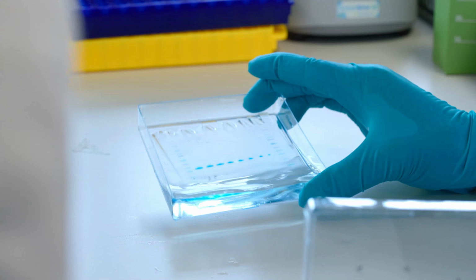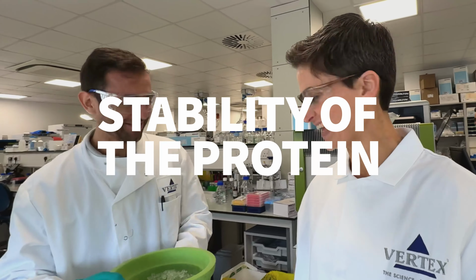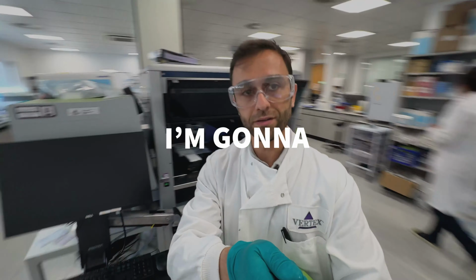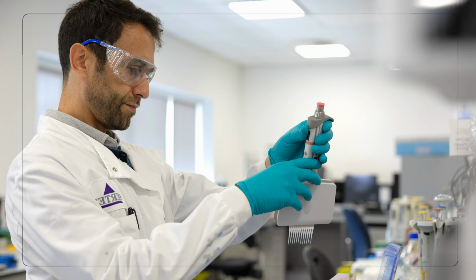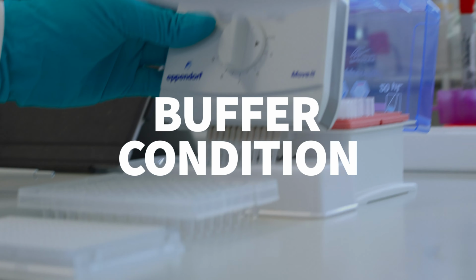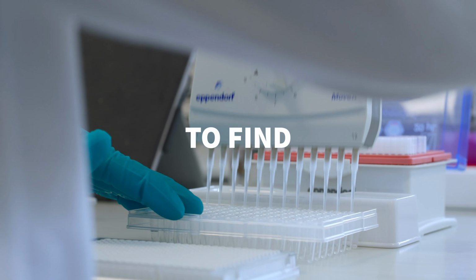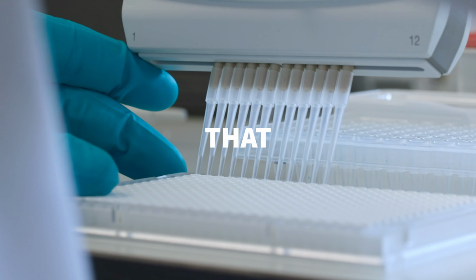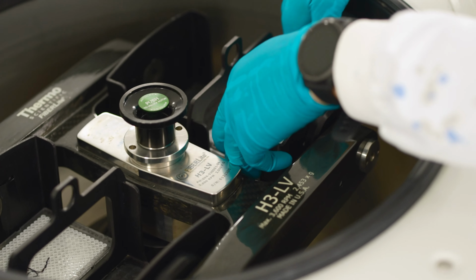I just received the purified protein from Rachel, and we will try to measure the stability of the protein. So this contains my protein, and I'm going to start by prepping the condition for Nano DSF. I'm going to pipette this protein into different buffer conditions. This is basically a mix of pH and salt. We want to find out where the protein is happy in that condition. Once we have the protein here, we're going to do a brief spin using this centrifuge to get rid of any air bubbles inside the wells.